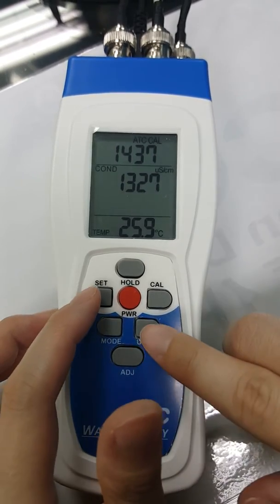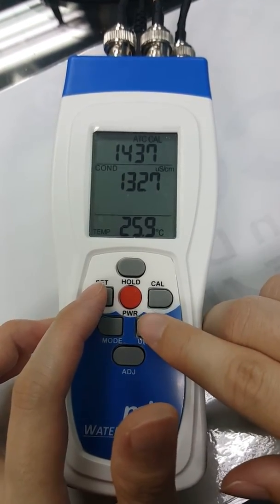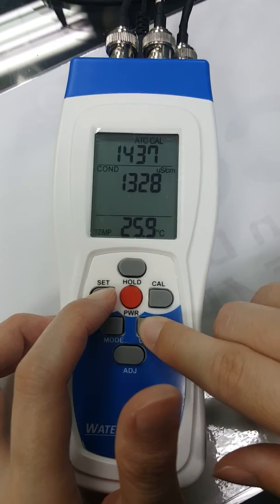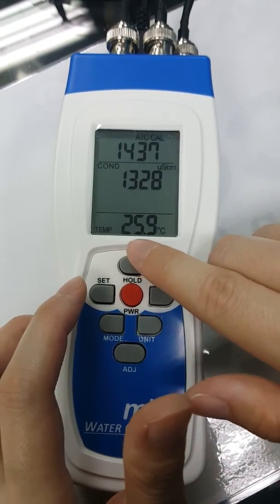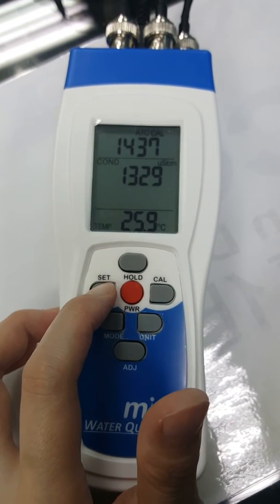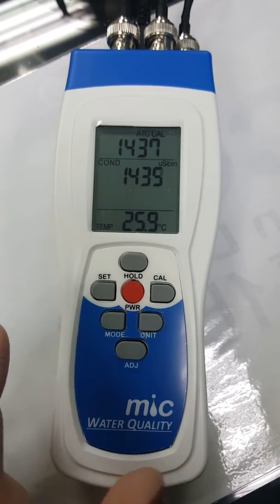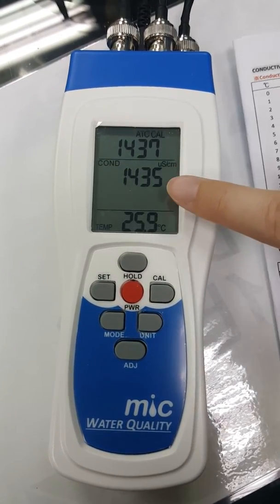The first time, we strongly recommend you do a factory reset. Long press the set button and the unit button. You can see the reading shows RFS. Then long press the set button to start calibration. Now you can see the reading has been calibrated.